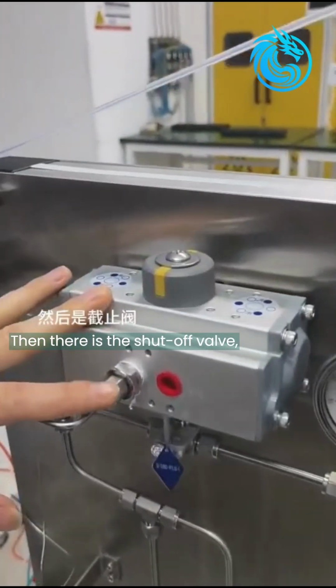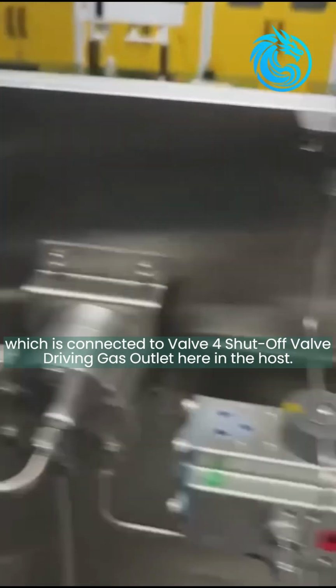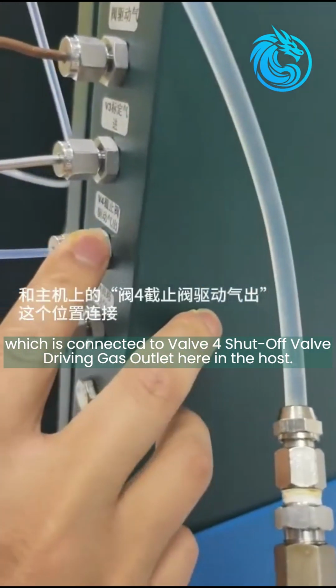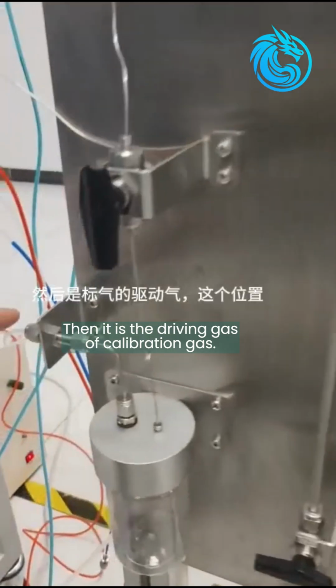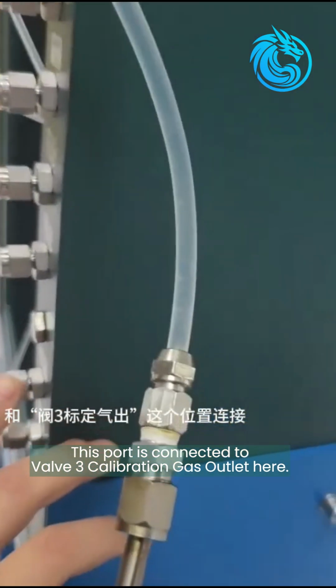Then there is the shut-off valve, whose driving gas is this port, valve 4, which is connected to the valve 4 shut-off valve driving gas outlet here in the host. This is the driving gas of the calibration gas. This port is connected to the valve 3 calibration gas outlet here.